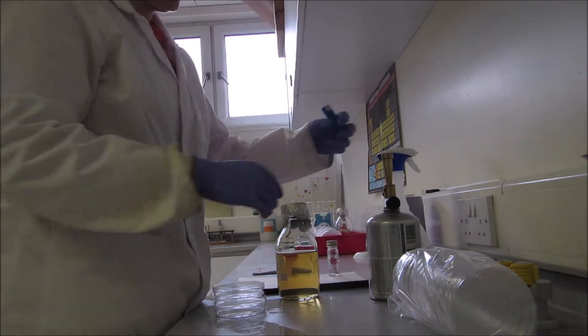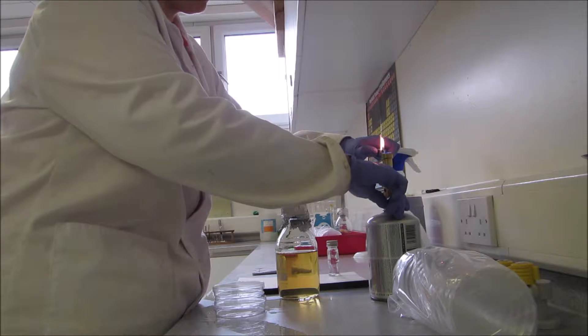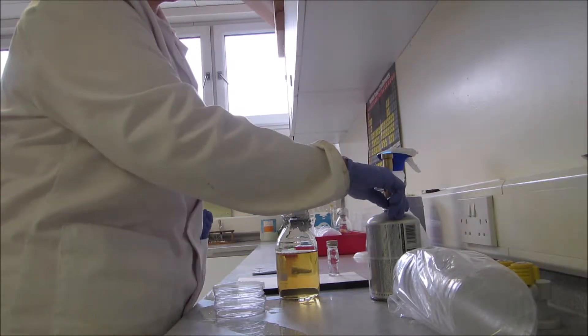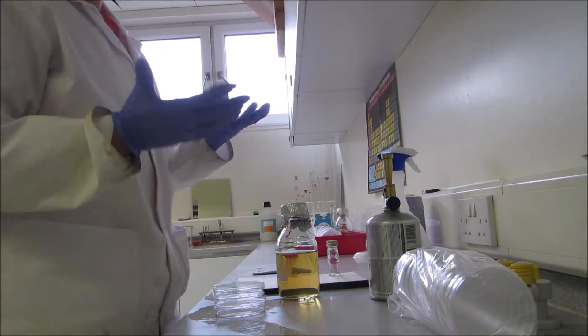Once your agar is ready and has been autoclaved, you can then pour it. I'm going to show you how to pour agar plates and also how to pour a slope culture.